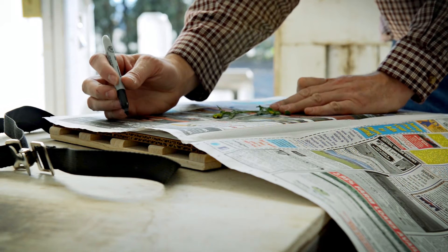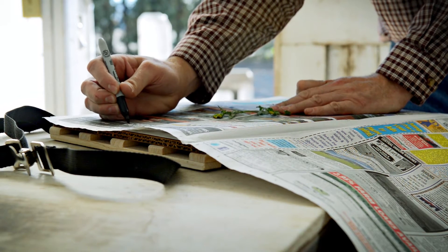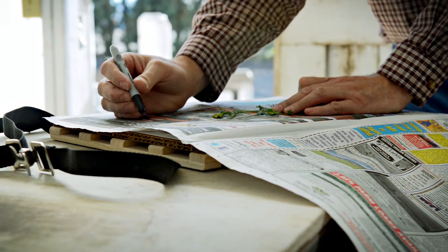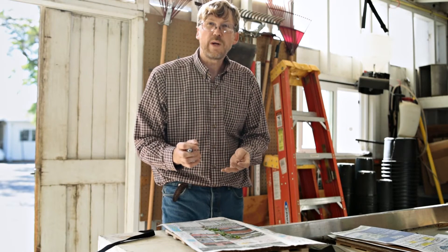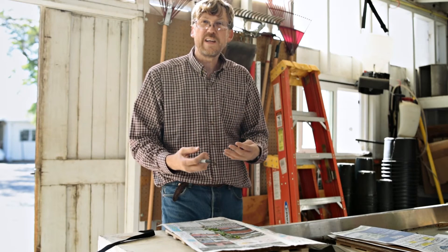Note characteristics such as alternate leaves. Also record where and when you collected it — the location and date. This gives us an idea of the habitat where that plant specimen is likely to occur.